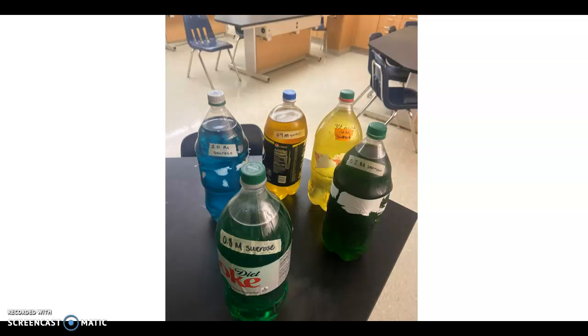There were a couple materials we used in the lab, but the main two materials would have been these solutions you can see here and a dialysis tube bag. So these are the solutions that we used. You can see they're labeled by their concentration of solute in each solution. The one with the highest concentration would be this blue bottle here, where it's 1 molar of that solute, and the smallest concentration would be this one here, 0.2. So those numbers represent how much solute concentration there was in each solution.